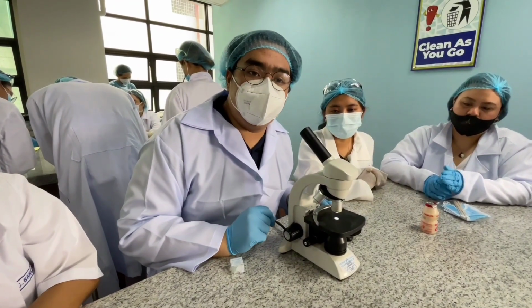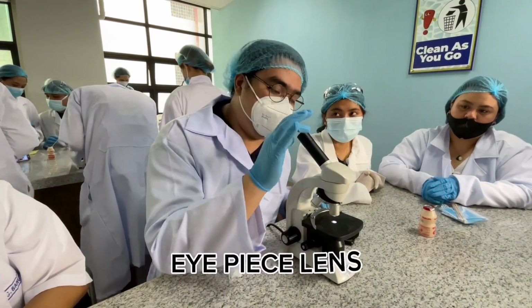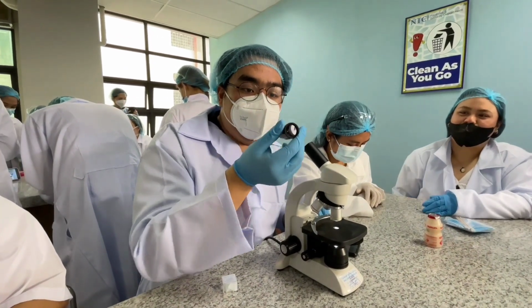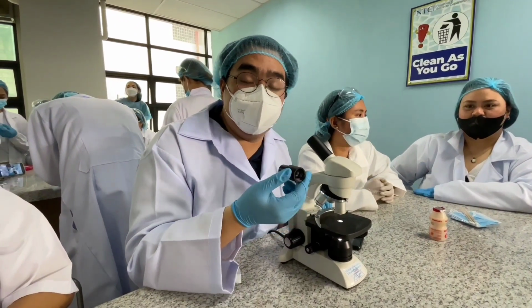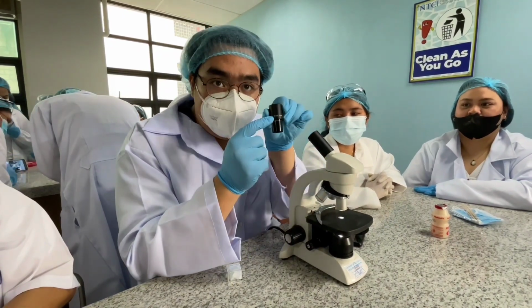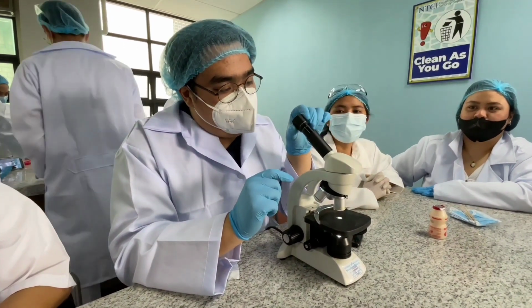Thank you, Roman. Now, the first part that we need to learn about our electronic microscope is the eyepiece lens. Now, the lens here is adjustable based on magnification. So if you want to use a specific magnification, this is where you would change lenses. Most of the time lenses show their magnification right here. Yes. So there, it just slides down like that.